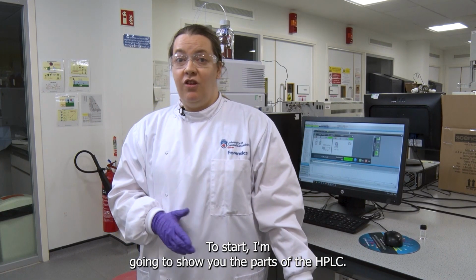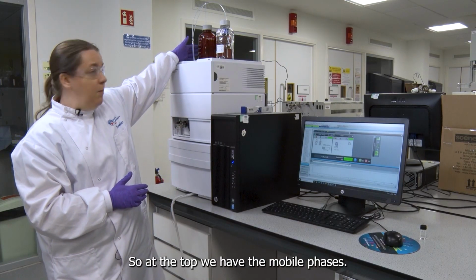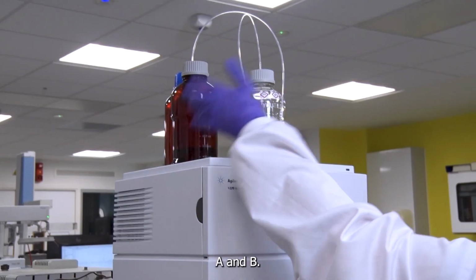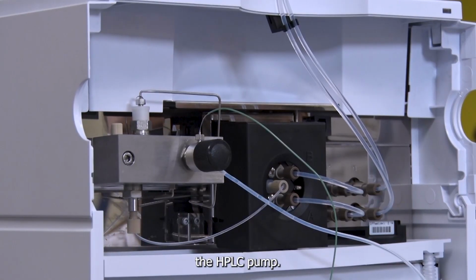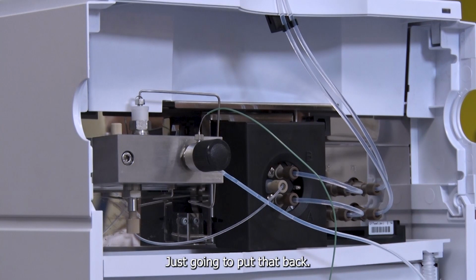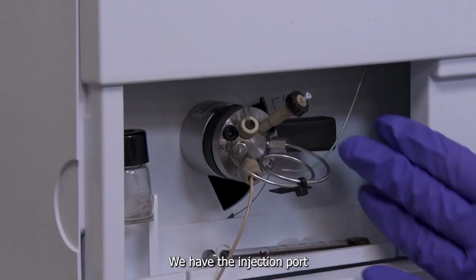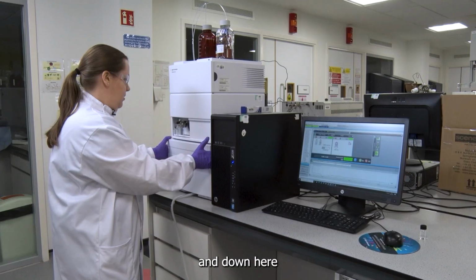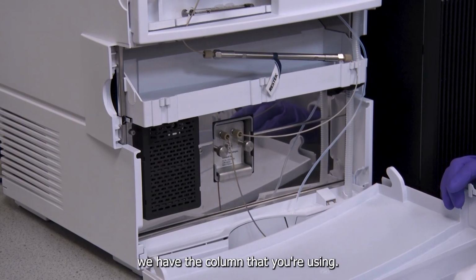To start, I'm going to show you the parts of the HPLC. So up the top we have the mobile phases, A and B. We have the HPLC pump. Just going to put that back. We have the injection port, and down here we have the column that you're using.